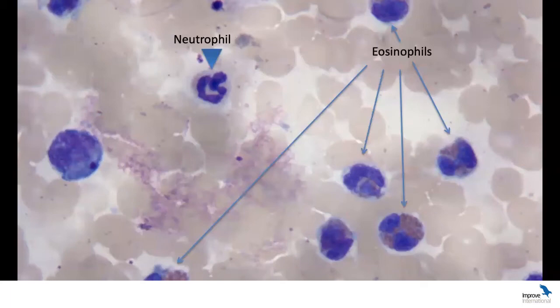Okay, so if in doubt, one of the ways to see if they are eosinophilic granules is to lower slightly the condenser. And remember, the condenser is what is just below the stage in the microscope we saw in the practical sessions. This will make the granules of the eosinophils slightly refringent, so you will see a small shining effect of these granules. If you're in doubt, is it a neutrophil or eosinophil? Okay, so it's always a good technique to see. So in this sample, you had eosinophilic inflammation. That was easy to identify.